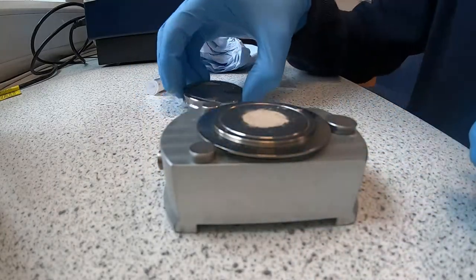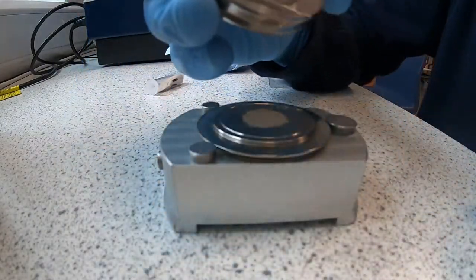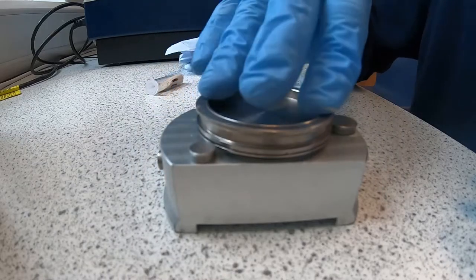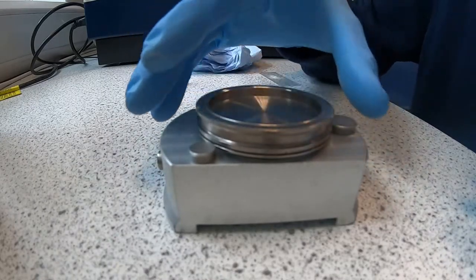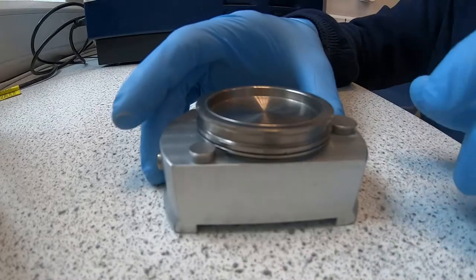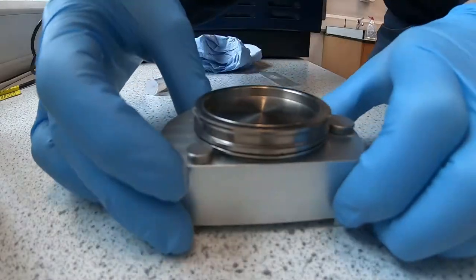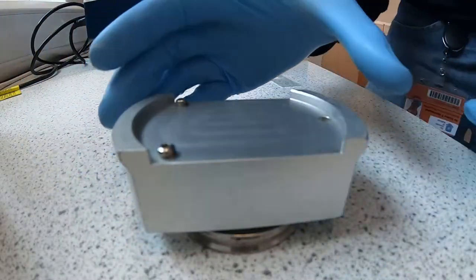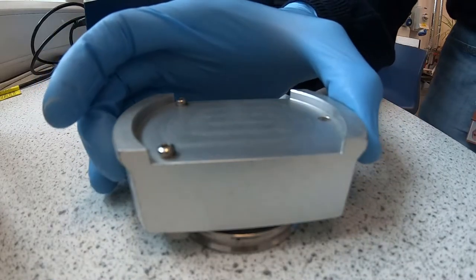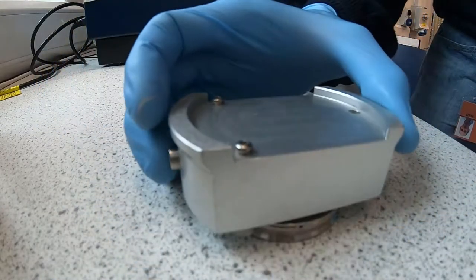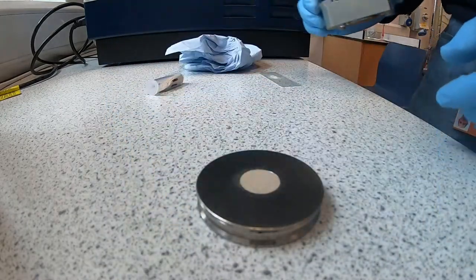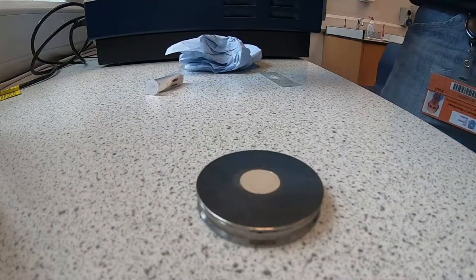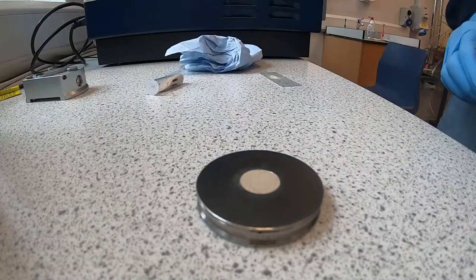What I'm going to do with this is try and flatten it out. It's got to be completely filled. I'm going to need a little bit of extra powder to make sure it's dense enough, especially around the edges. Great. Now I'm going to put the back plate on and that's going to clip over the top like this. Push down and it clicks. When it clicks, that means it's secure. Now I can put the whole thing upside down for the big reveal. Press that button in at the side, press it in and lift it up. We've got a perfectly flat surface of a sample ready to go in our instrument.